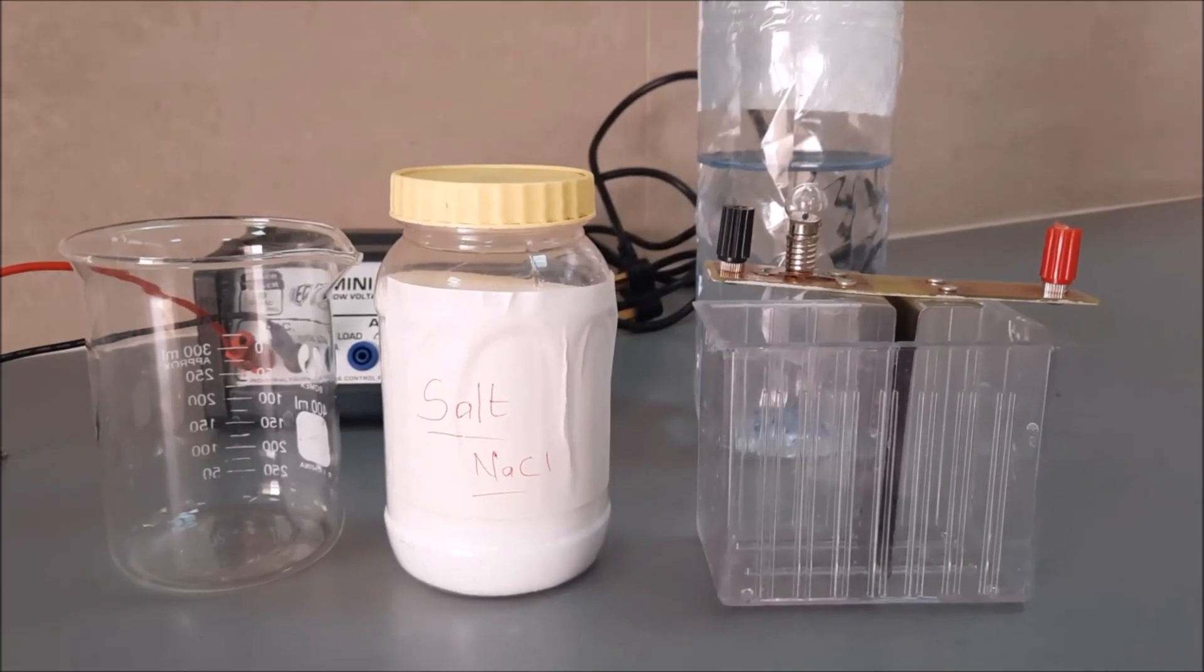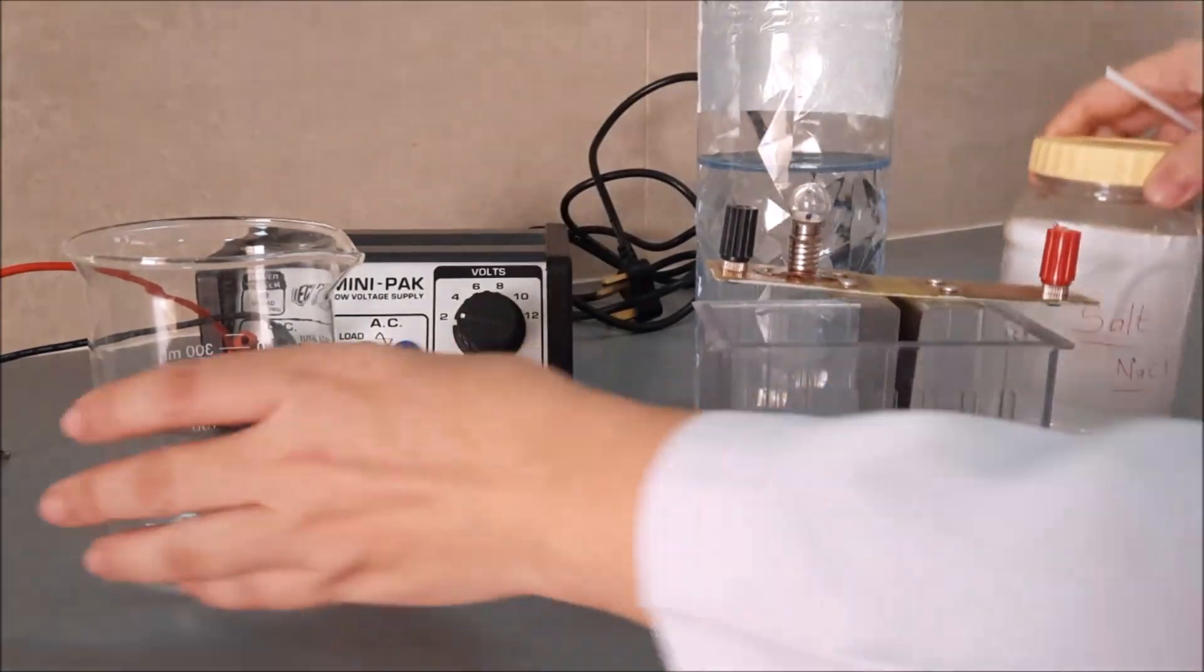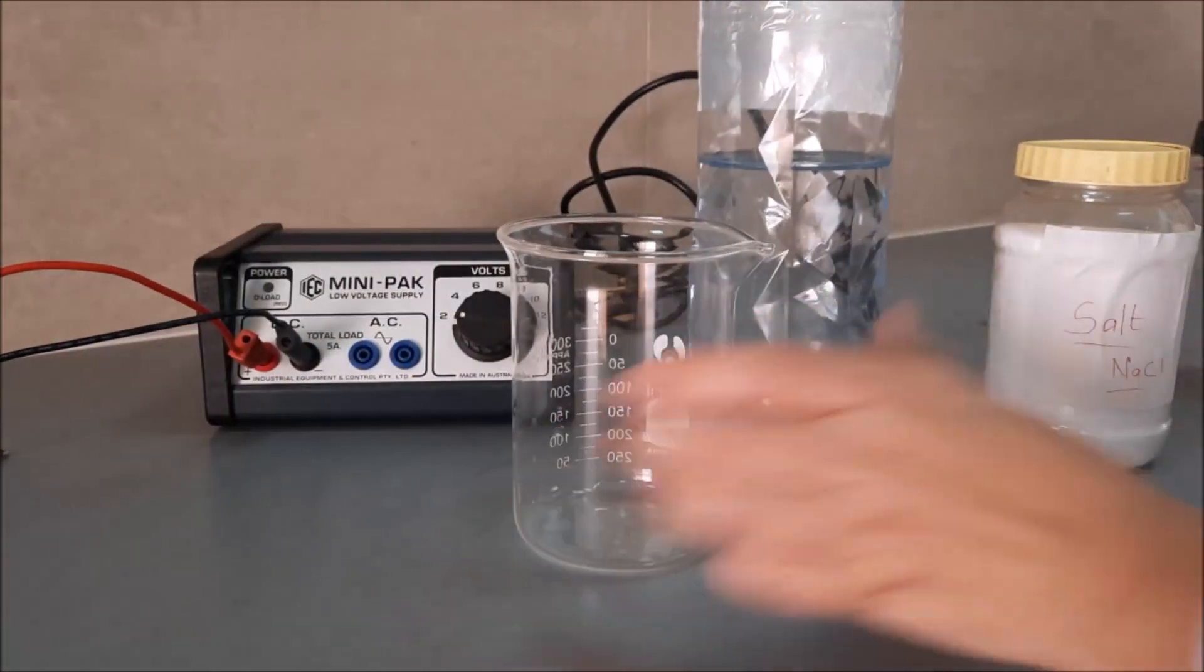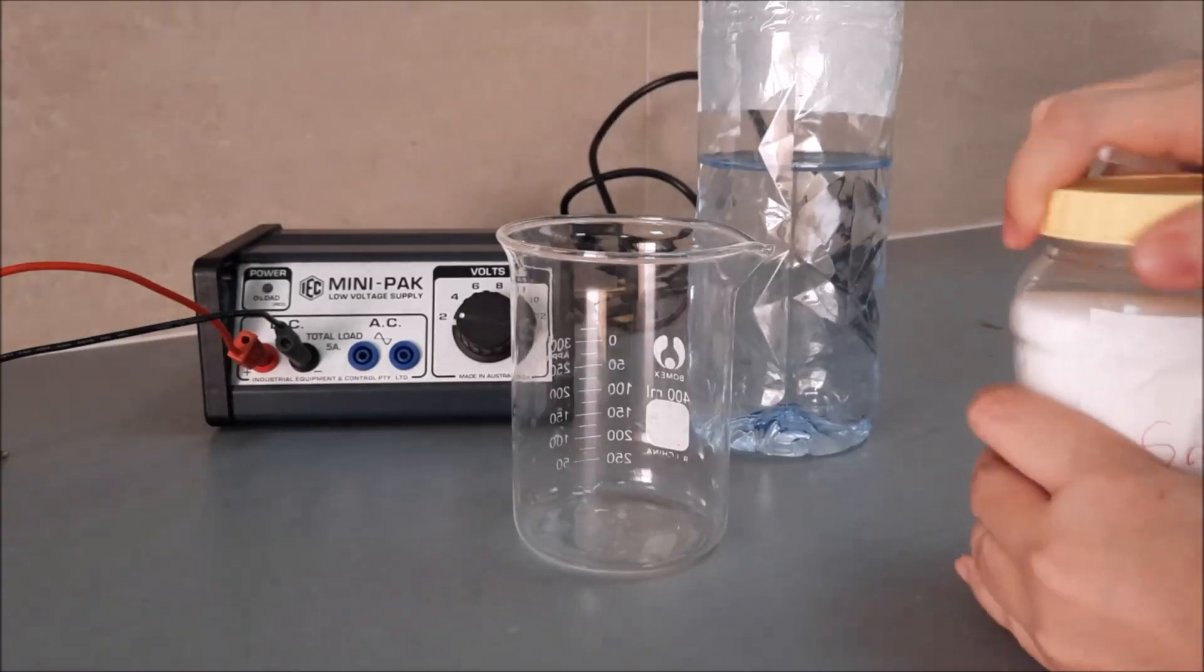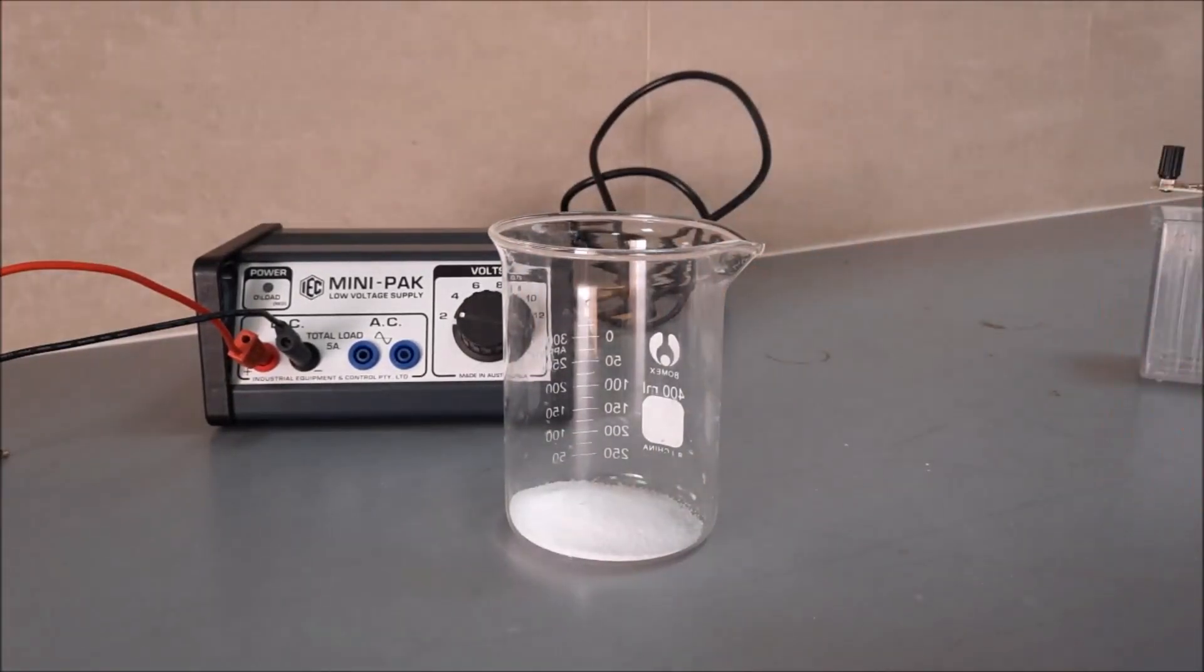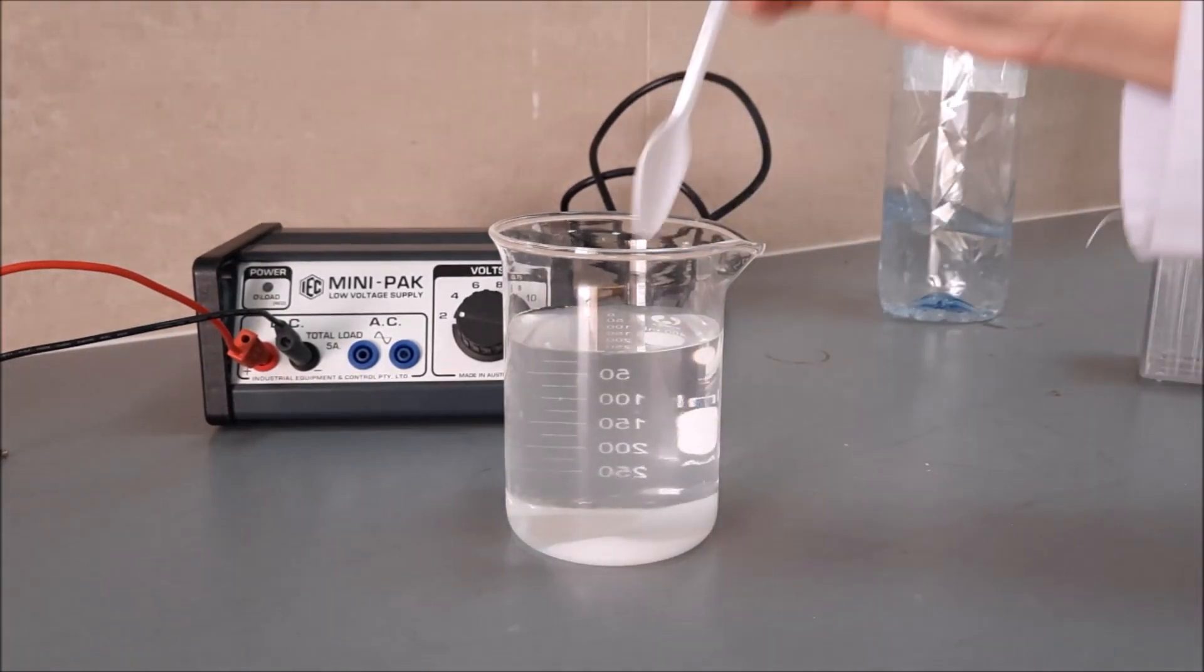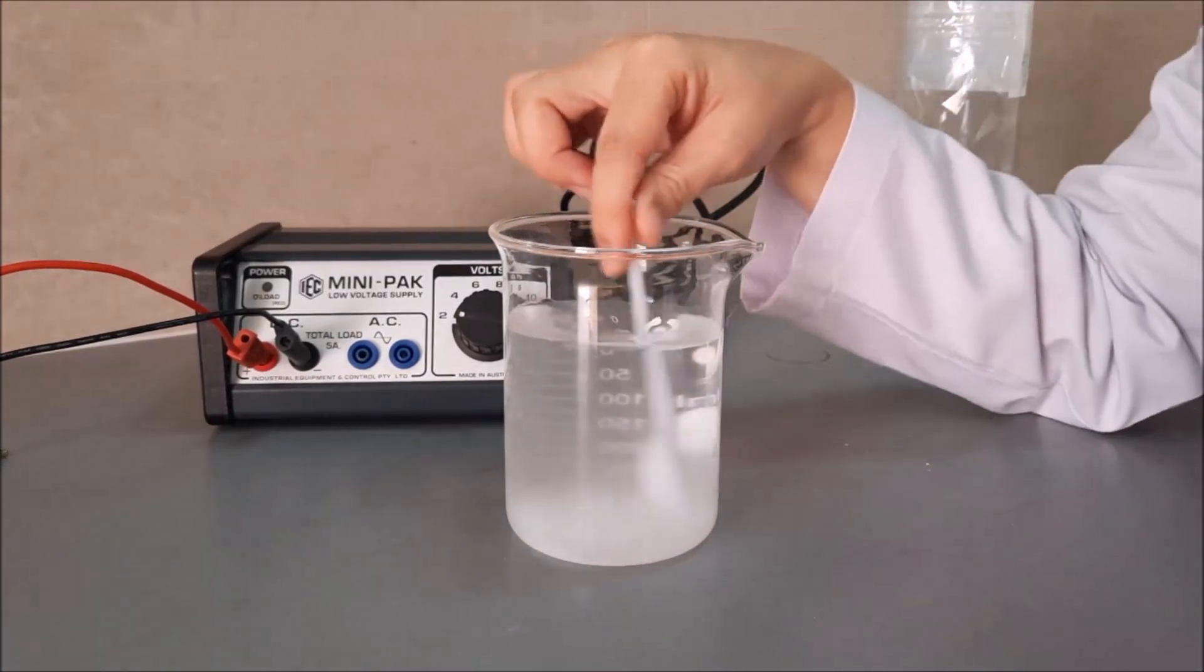First is, we're going to make a salt solution. So this is the beaker. I'll put some salt. Some distilled water.